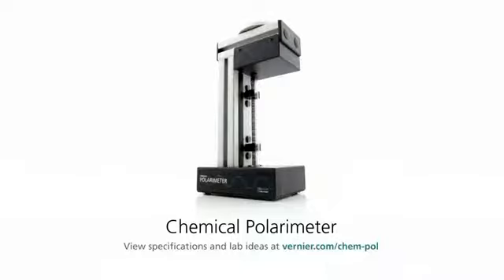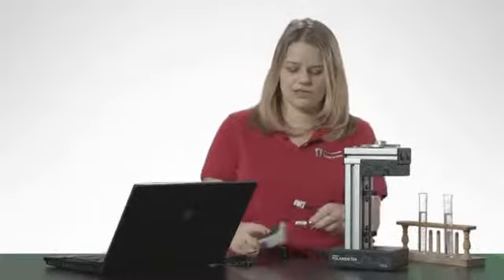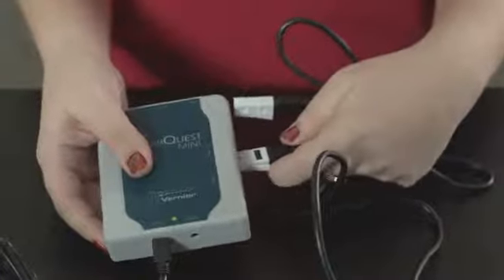A chemical polarimeter is a device for measuring stereochemistry of molecules, and today I'm going to give you a brief introduction on how to use the polarimeter. First thing to note is that it has two cables coming out of it. One is an analog and one is a digital. They will only fit into specific ports on your interface.